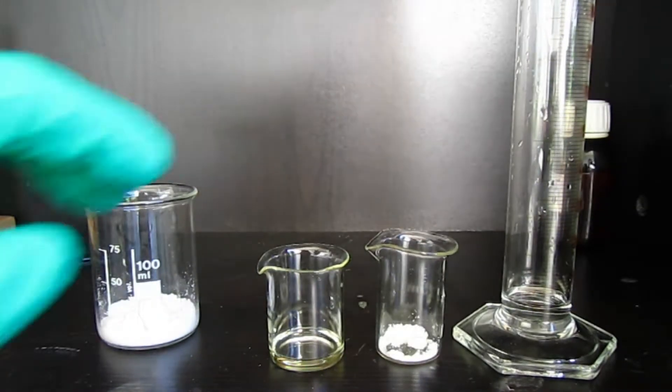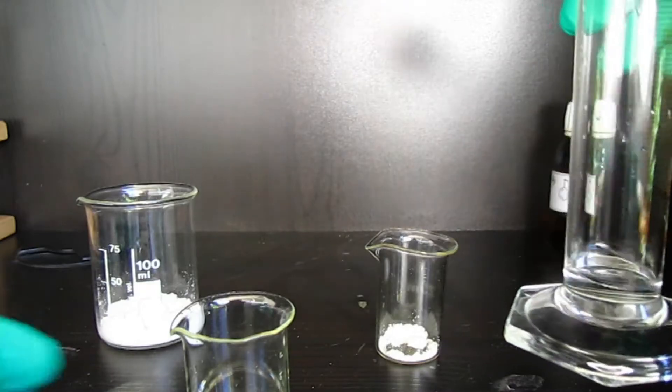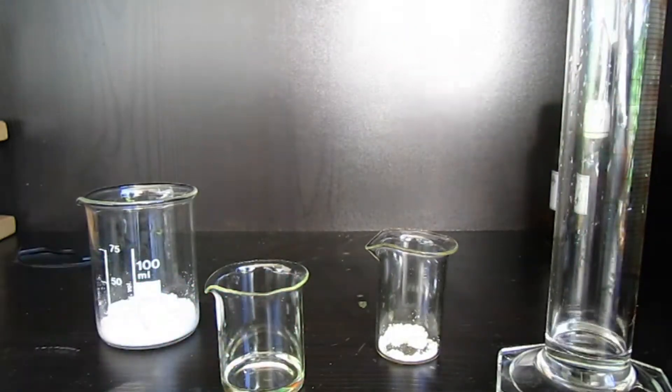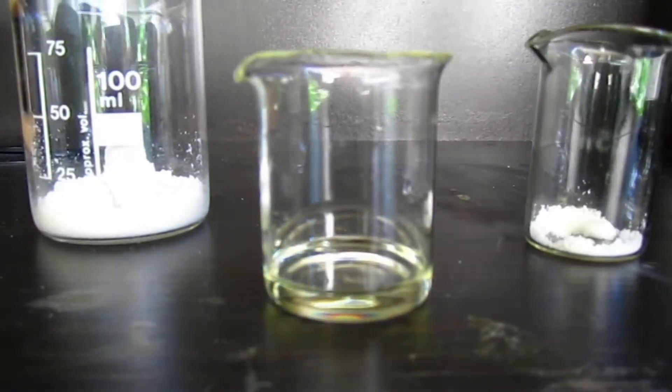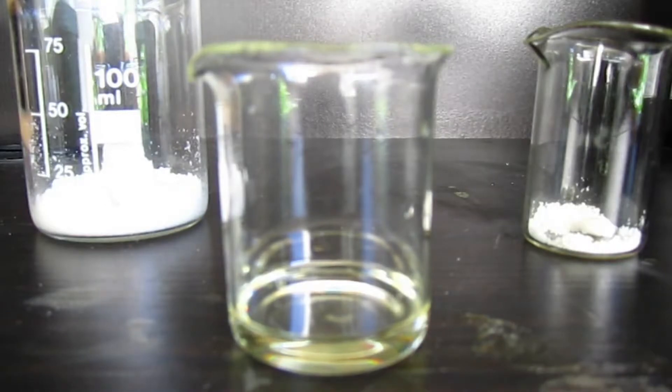First, I'm going to dissolve the aniline in this hydrochloric acid. It's going to be quite exothermic, actually, so be careful. It's going to create aniline hydrochloride.